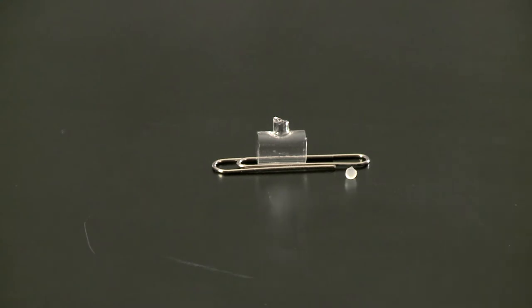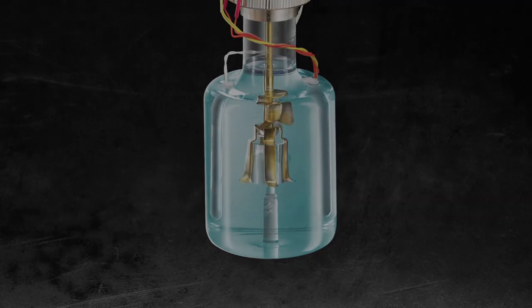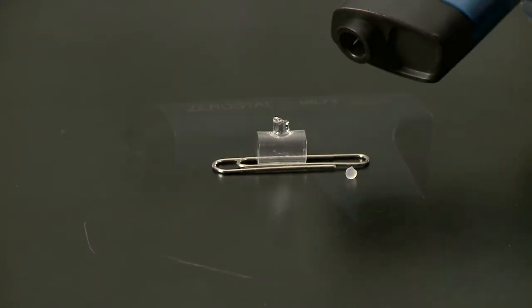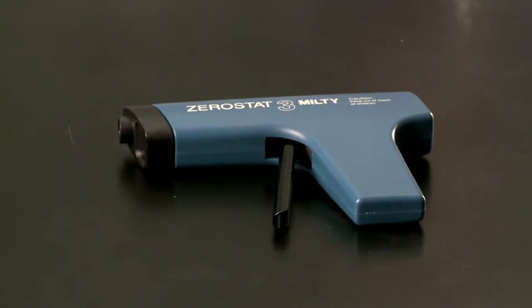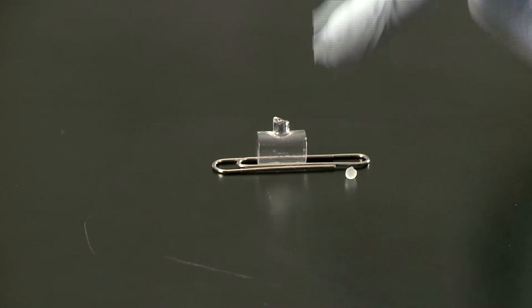What we have here is the crushing ampule for the solution calorimeter. What you'd have to do is first tare it and weigh it, and sometimes you need to use an anti-static gun or device for the rubber silicone stopper and also the glass crushing vessel so that you get a very stable weight.